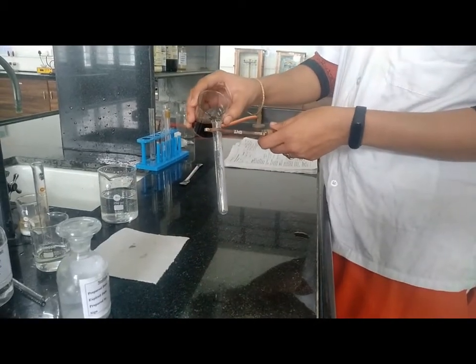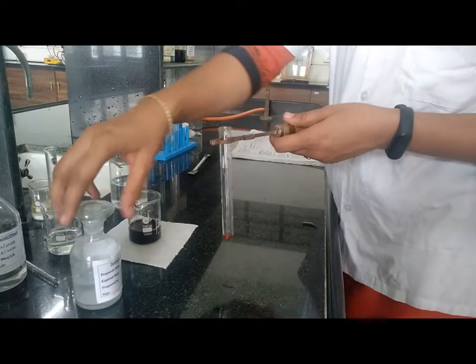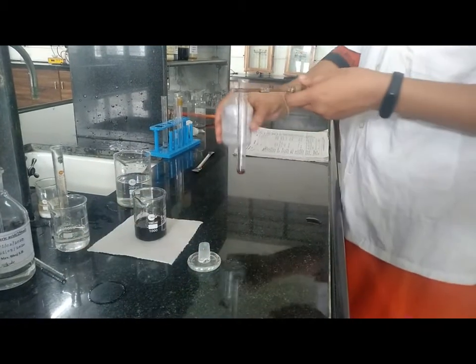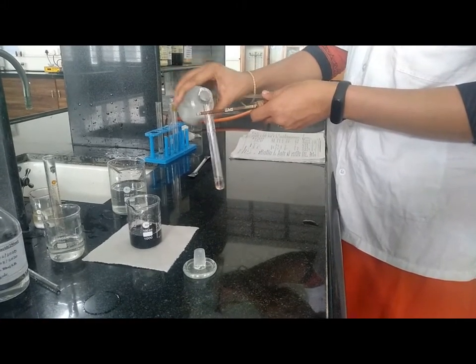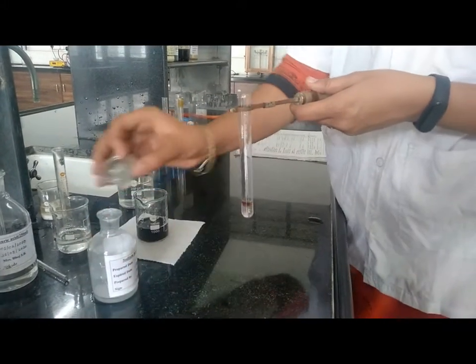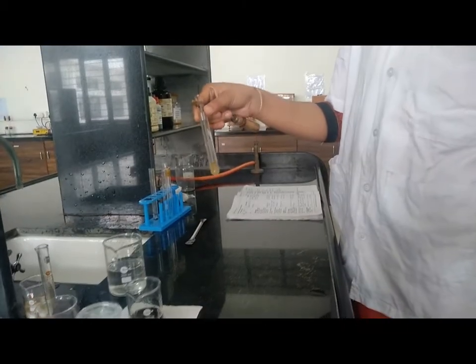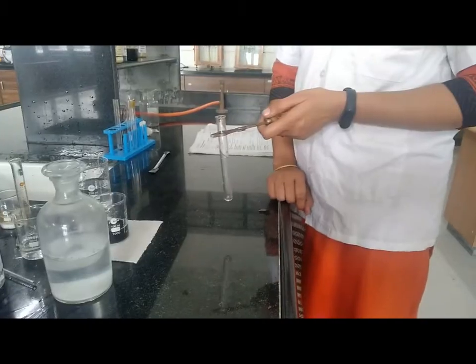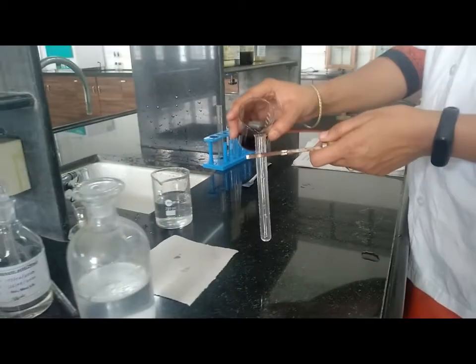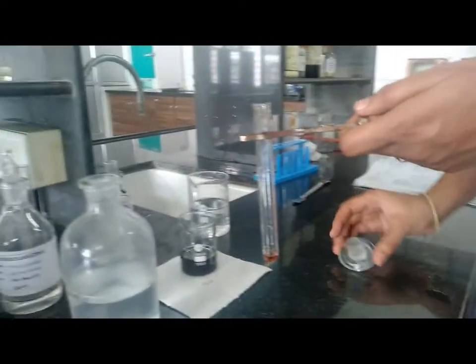Solubility in 10% sodium bicarbonate solution: take a few drops of the organic compound and add sodium bicarbonate solution, then check the solubility. Next, add 2N NaOH solution and check solubility. Take a few drops of sample and add 2N NaOH solution.